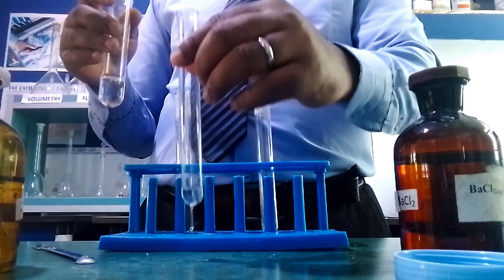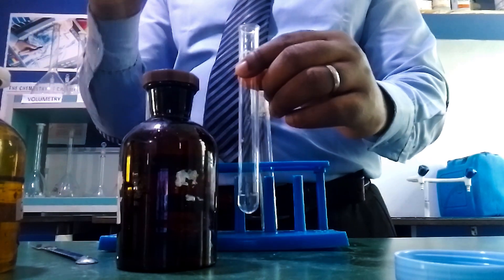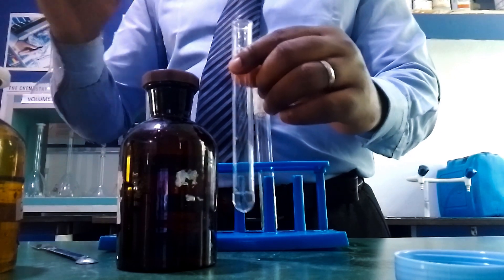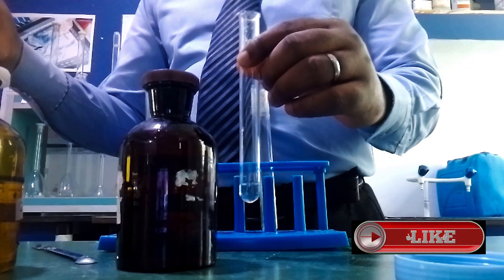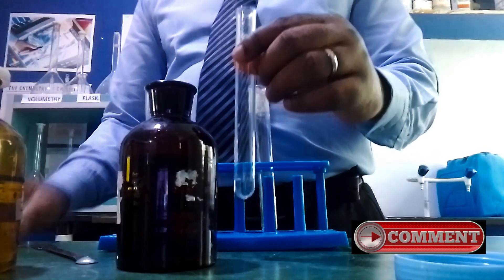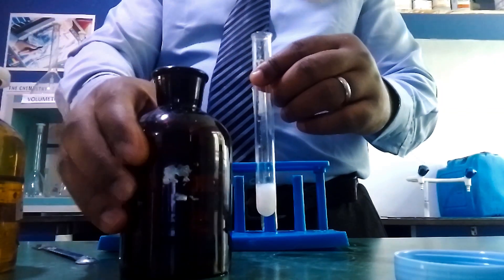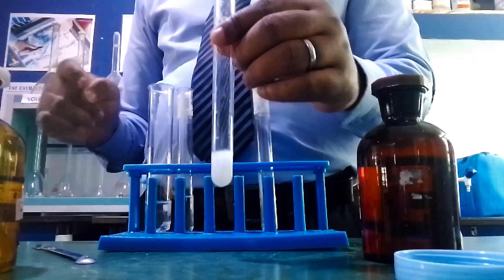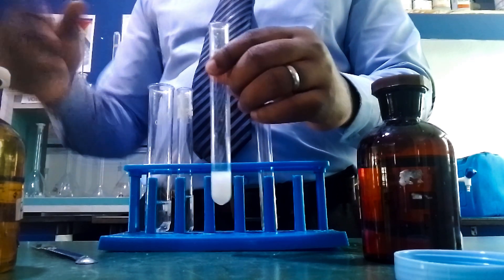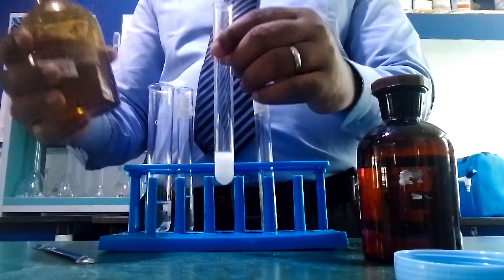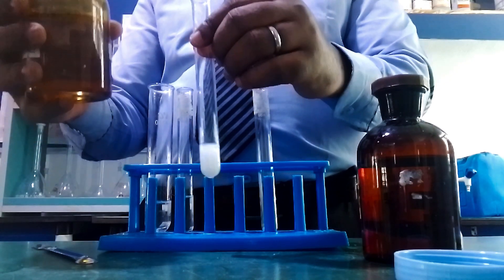Add barium chloride to the solution. When I see barium chloride, three ions come to mind: sulfate (SO₄²⁻), sulfite (SO₃²⁻), and carbonate (CO₃²⁻), and sometimes sulfide (S²⁻). You expect a white precipitate here. This white precipitate could be SO₃²⁻, CO₃²⁻, or S²⁻. If it's SO₄²⁻, the precipitate won't dissolve in excess acid. Let's see what happens.